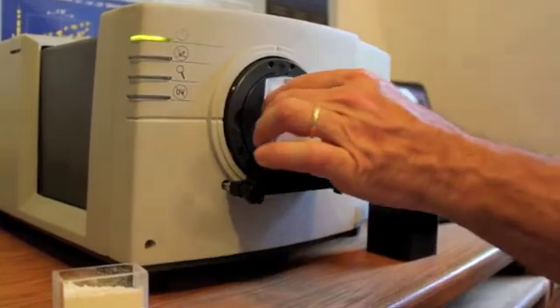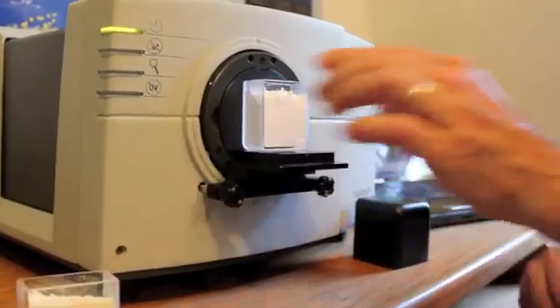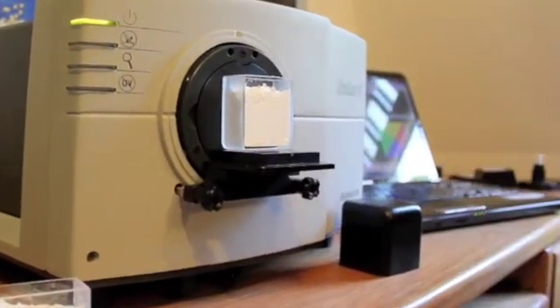We'll measure our first sample, which is a nice bright powder, and define this as our standard.